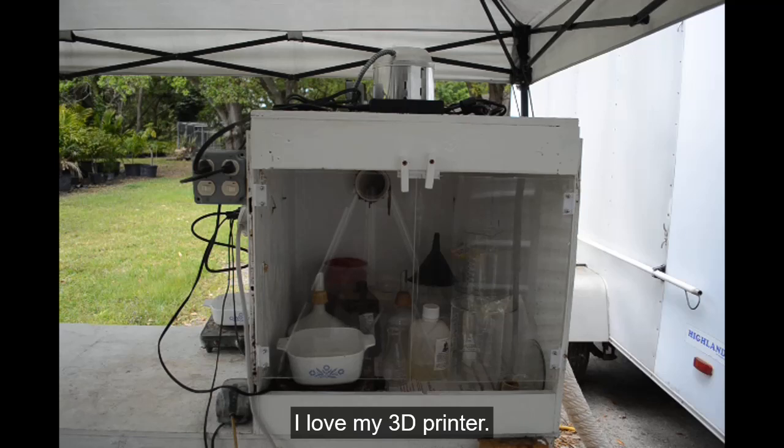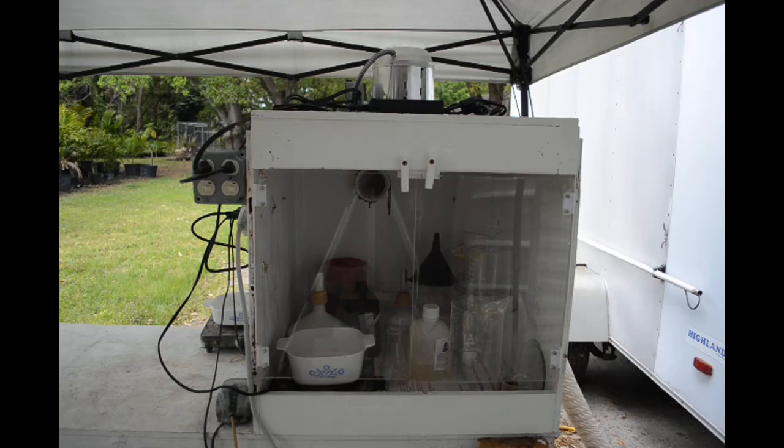I have 3D printed plastic hinges now on the doors because the steel hinges that were on there before were all rotted out from the chemical fumes. So hopefully these plastic hinges will hold up much better with stainless steel hardware.